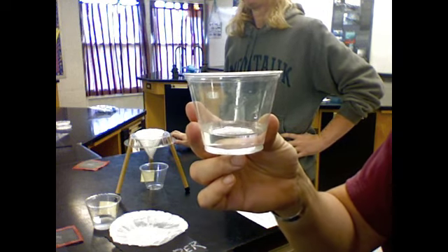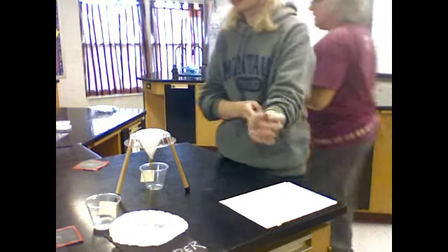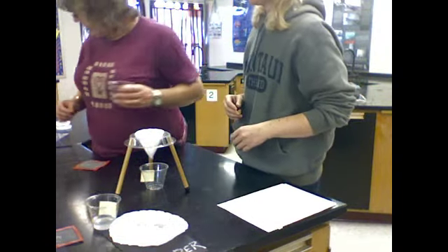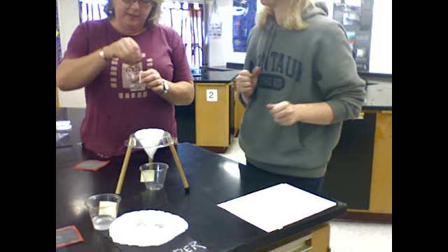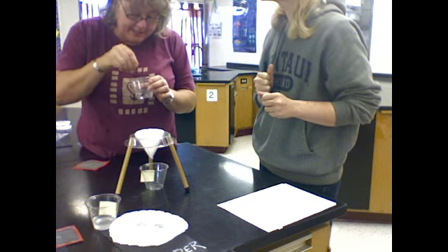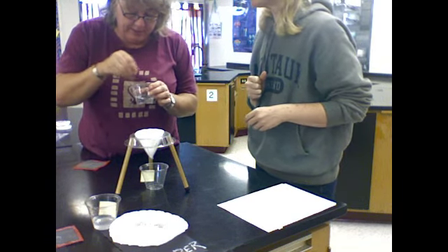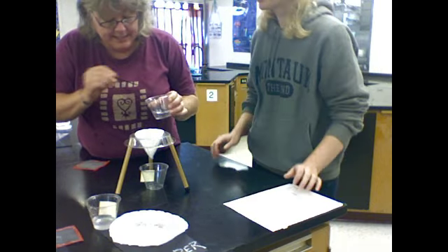So I'm thinking, how are we gonna know if it worked? The powder in the water wasn't clear. Maybe we'll see it on this filter paper. Okay, where's my stirrer? It's in that cup there. So I'm stirring. There really isn't anything for me to pick up at the bottom like there was with the powder. No, I don't see any salt crystals in there anywhere.